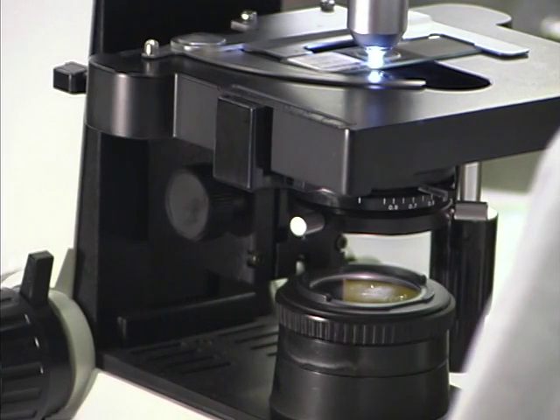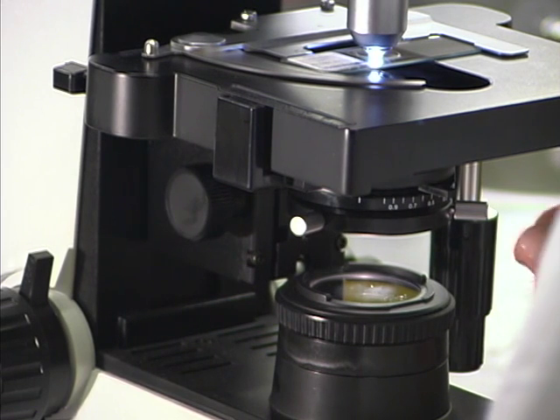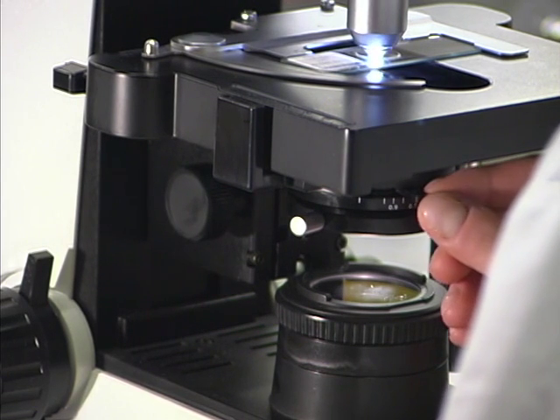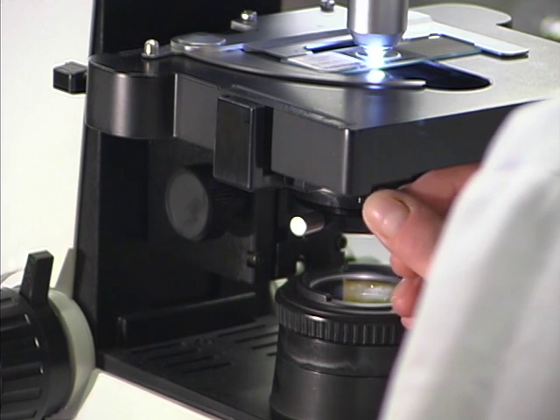Generally, the iris diaphragm is opened more widely with objective lenses with higher magnifications. Closing the iris diaphragm increases contrast.